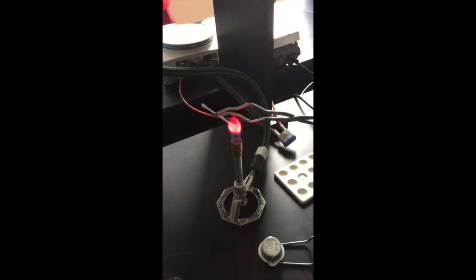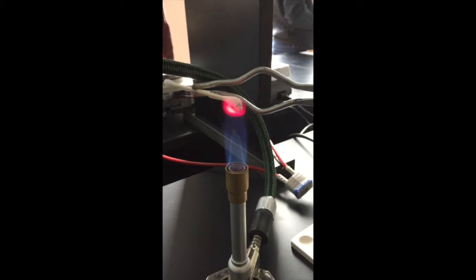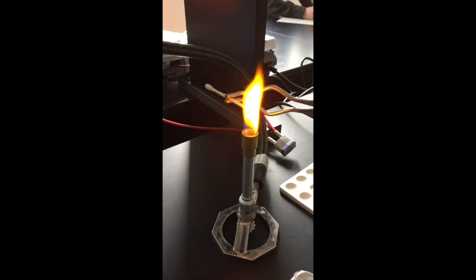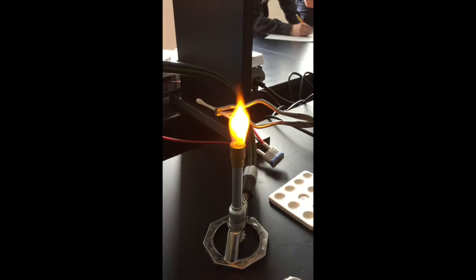When the flame test was done for substance number 20, the group noticed that it yielded a very hot pink flame that was at an extremely high intensity, and the flame later changed to a dark red color as it died out. When the group held substance number 21 to the flame, the group noticed that it was a bright orange flame at a very high intensity and made a very audible crackling noise.